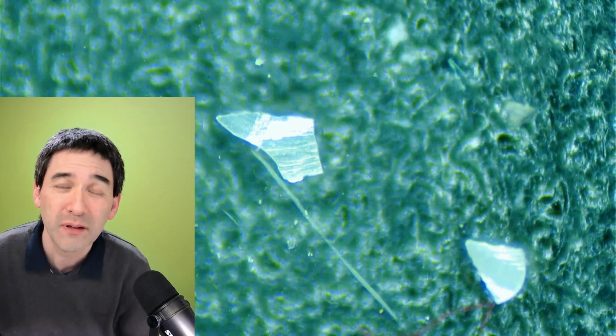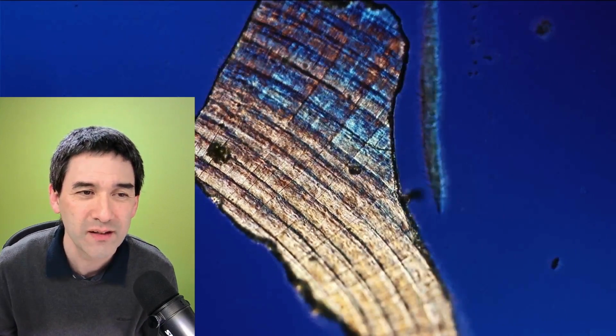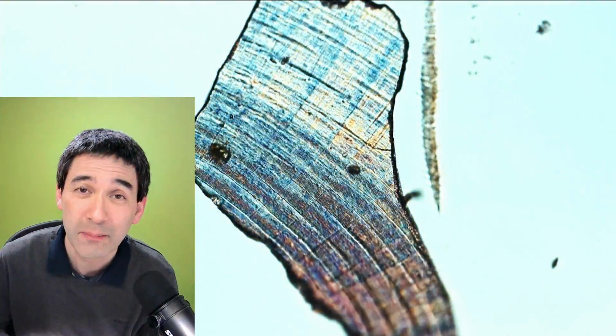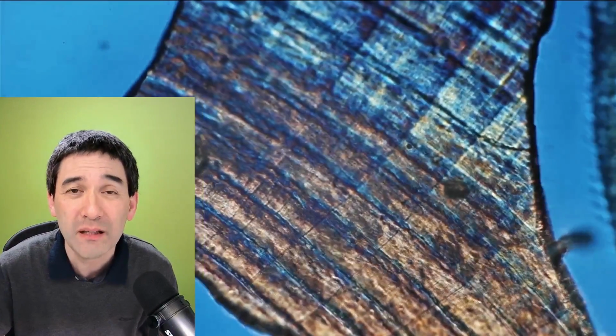Okay, and I decided, how am I going to do this reaction then? So here it is again. Actually a very nice specimen again. So how do you do this reaction? Well, I put a cover glass on top, of course, to stabilize everything, and then I used approximately 20% acetic acid and carefully added it beneath the cover glass.